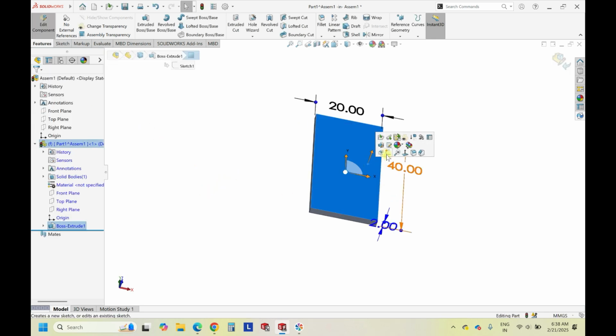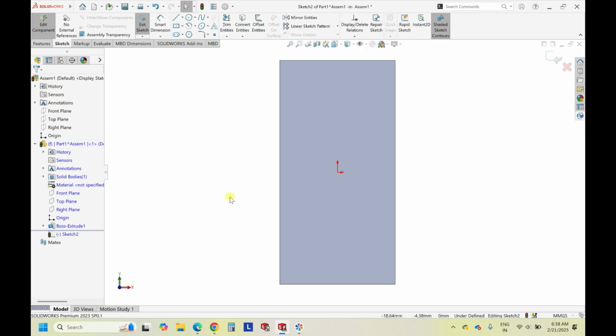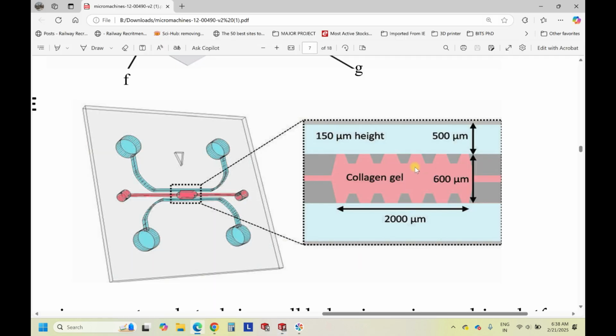And select this place, click on sketch. So now this is where we start the designing. So if you see in this, the main tricky area is this collagen gel area, these grooves. Most of the researchers face difficulty in drawing this region symmetrically, and it should be so precise that cells should come and capture in that. It is not that the cell culture media should enter into the gel.